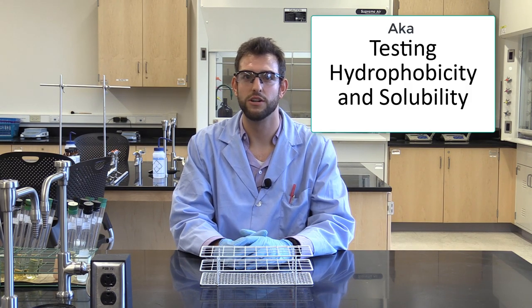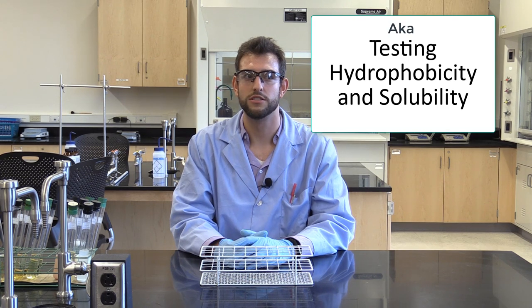Hi, my name is Dr. Scott Melidio, and today I'll be going over the soap lab demo.